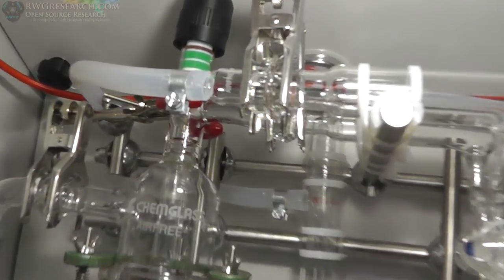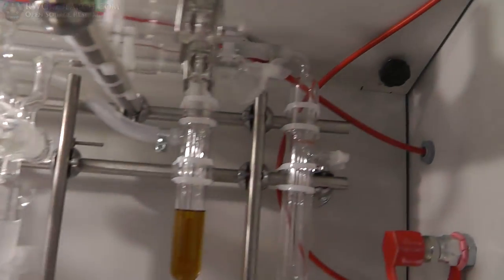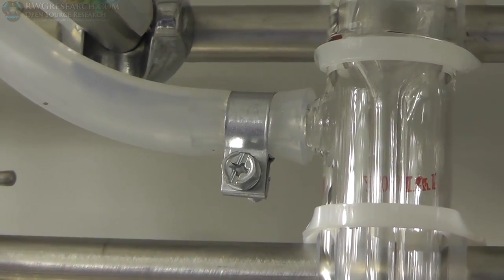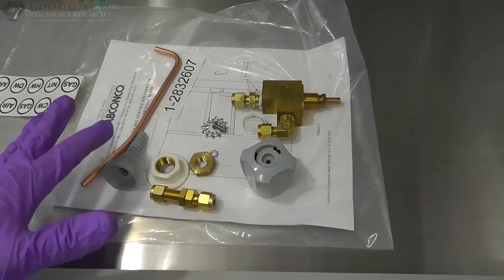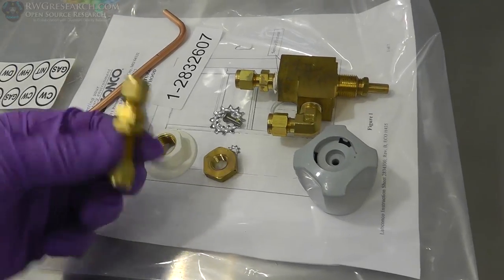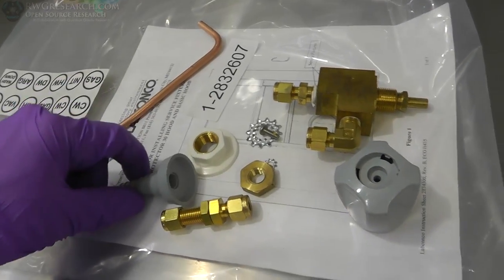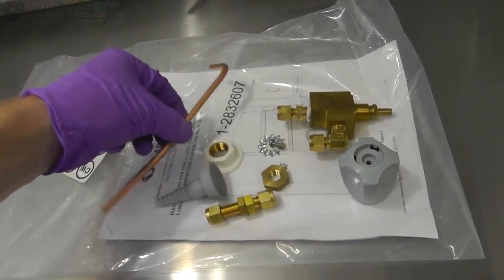Yeah, I guess you'd like to see them. There they are. That one and that one. There's one on the top that's hard to see. And these over here. They work really well. There is the valve assembly. So this is actually for this lab hood, designed for it. So you got the valve, the knob, fitting to hold the inert gas coming in, the barbed fitting that you put on the inside of the hood, and then the stickers, and then the gas line going out.